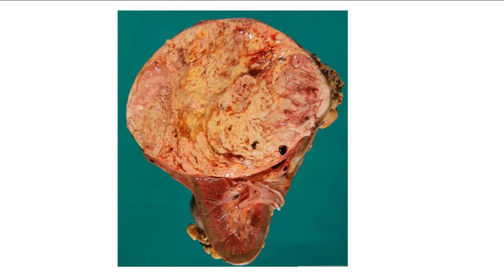Maybe Tavia was thinking of this subtype when she told us about pheochromocytomas earlier. That's a clue to the name of the subtype. No, so remember carcinoids are separate.